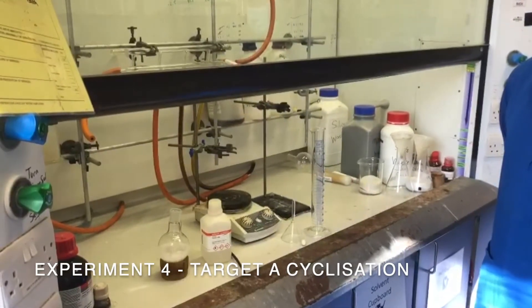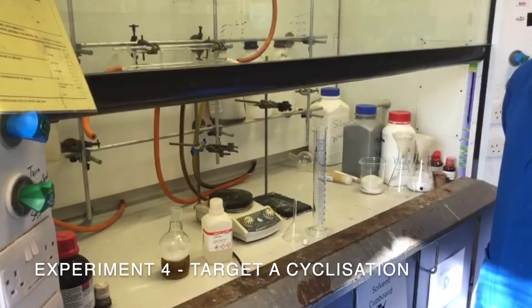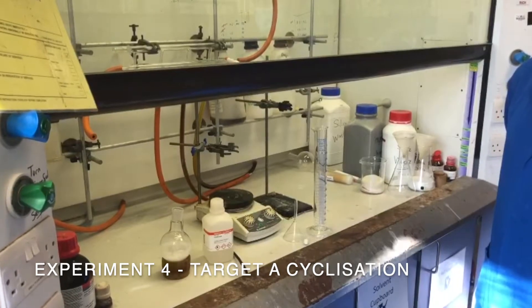Welcome to the final step of Target A of the Drug Discovery Labs. So this is going to be the cyclization of your protected dipeptide.